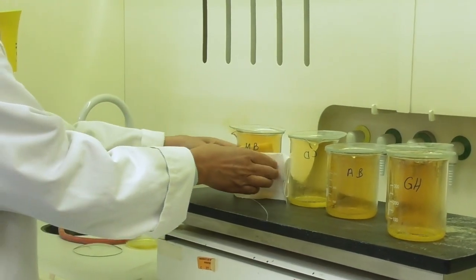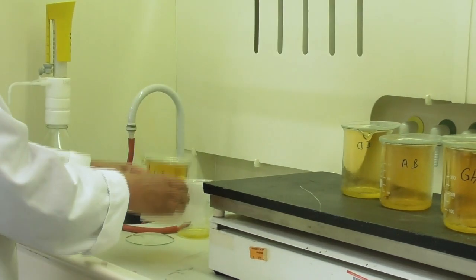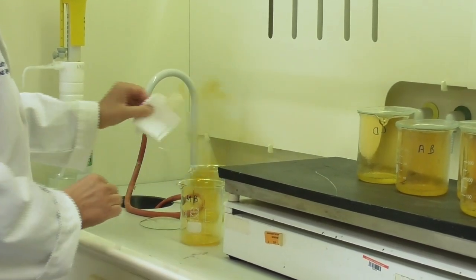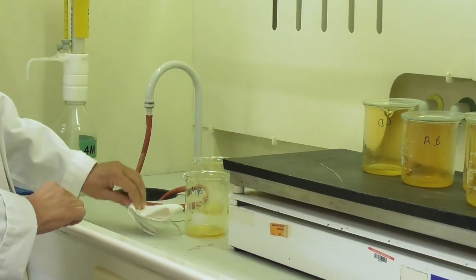After the reaction time I remove the beaker carefully from the hot plate and remove the watch glass to let the gas escape.